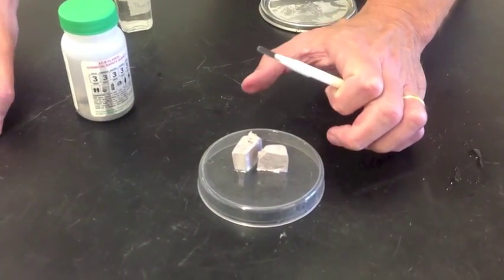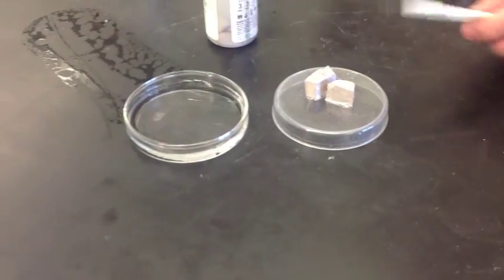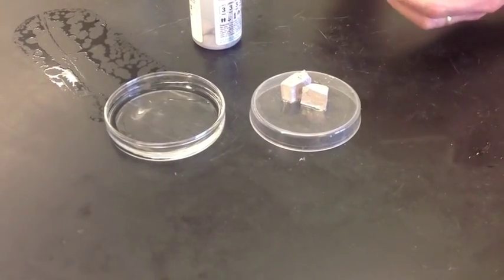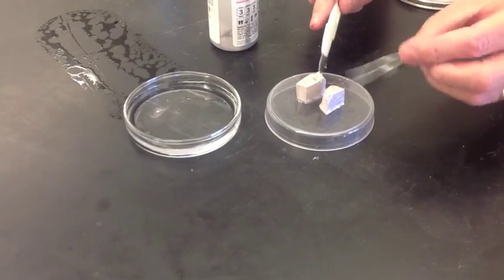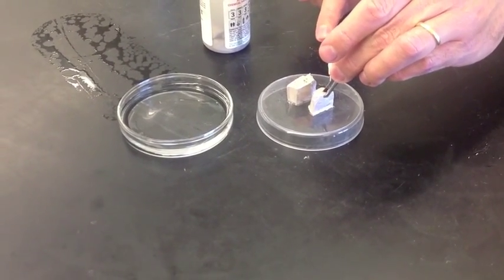Now over here, I have some water. And I'm not going to put a huge piece into it because, first off, I don't want to waste it. And second, there's hydrogen gas that's produced. And the hydrogen gas can explode. So we don't want that to happen, even though it might be kind of cool looking.